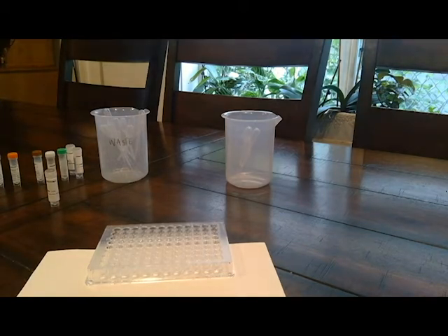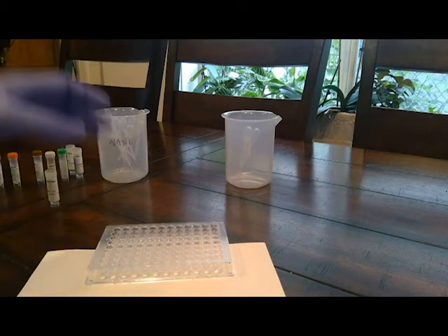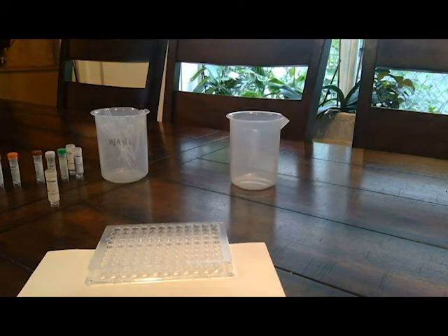So take a new pipette and without allowing the pipette to touch any of the liquid in the wells, add 3 drops of simulated chromogen to each well in rows A and B. All the rows should contain a light green liquid at this point. All right.